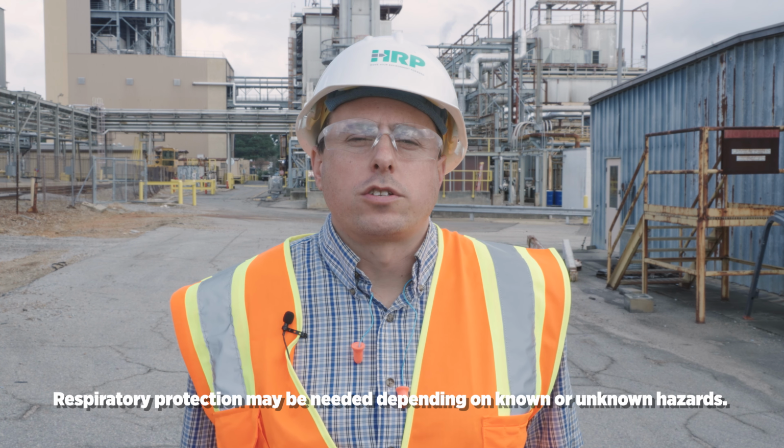Because we do not know the hazards of the material, we want to wipe our jar, and any materials that we generate, including the residue that we clean from our sampling apparatus, we want to put back in the original container that contains the material. We don't want to release any of this to the environment.